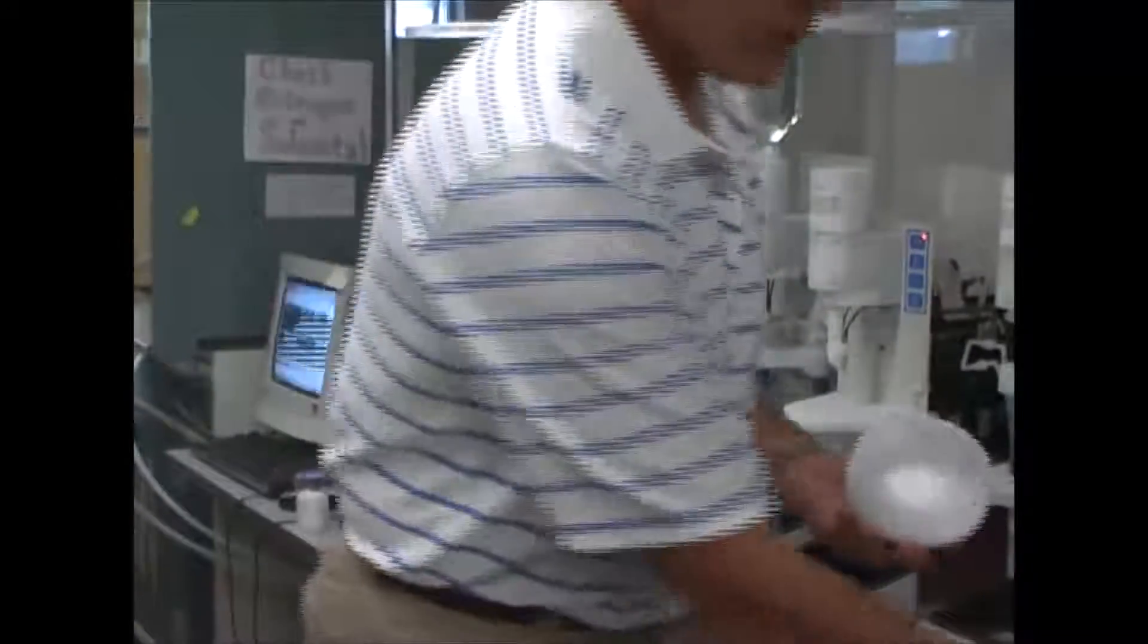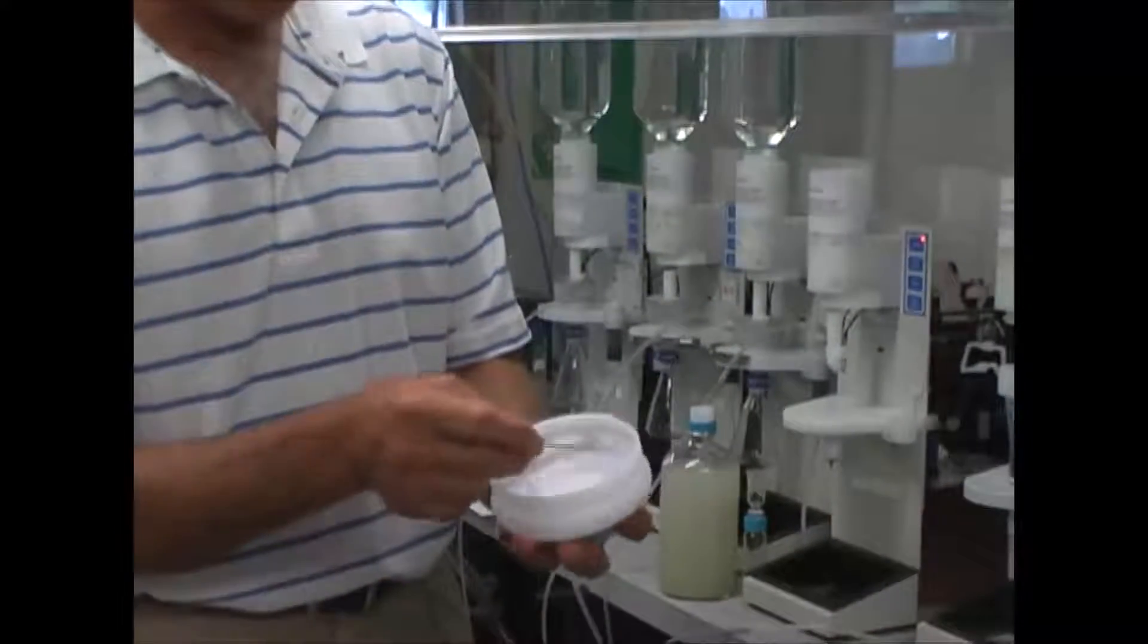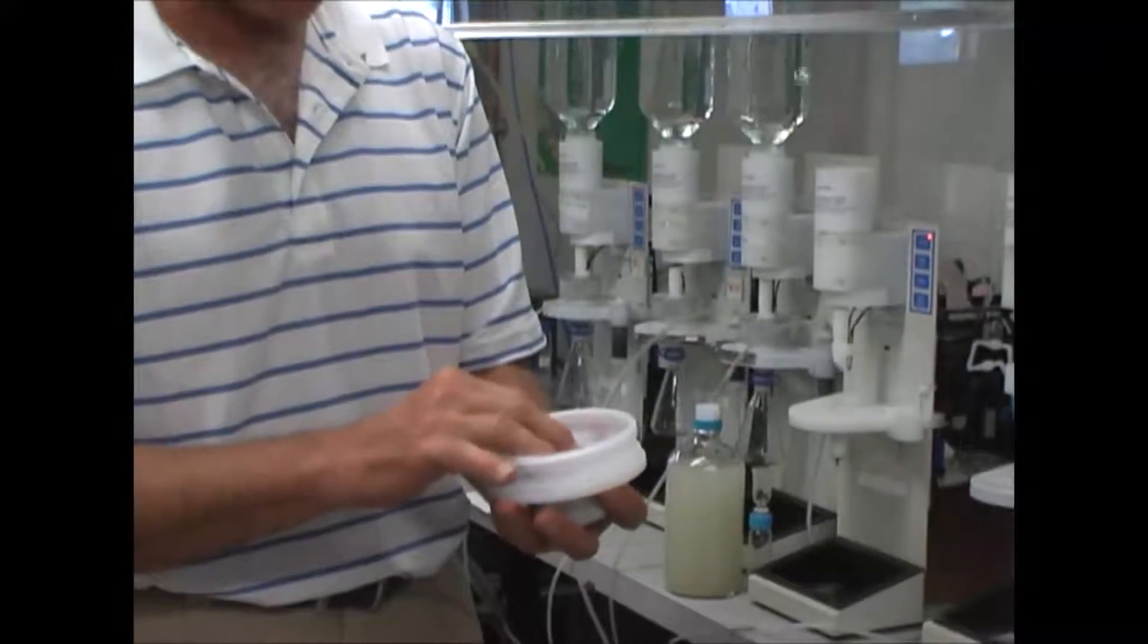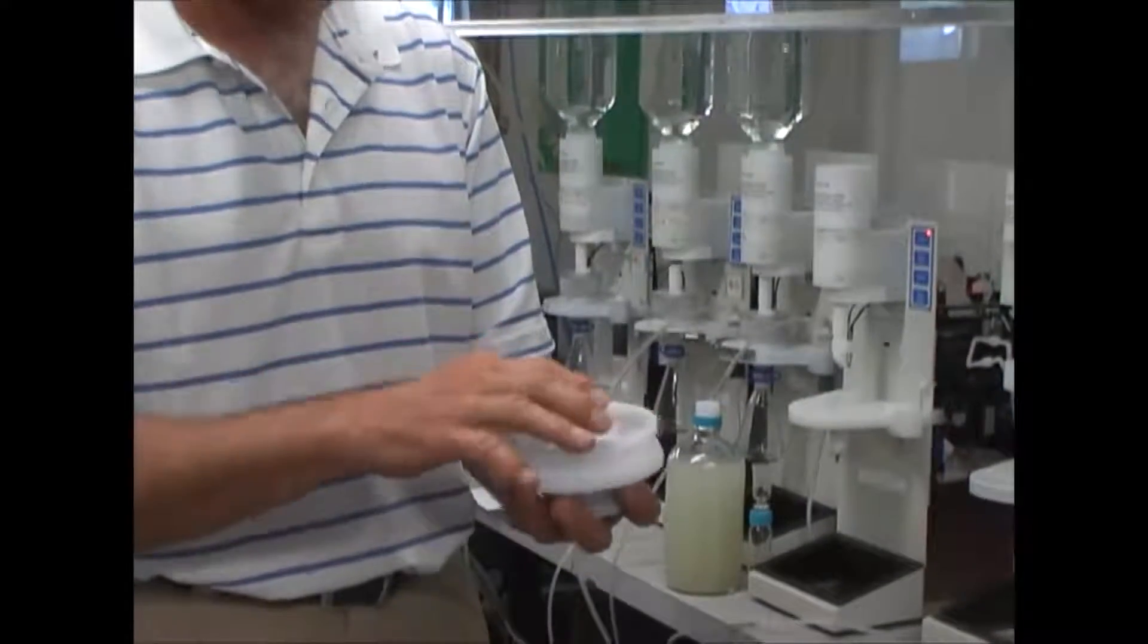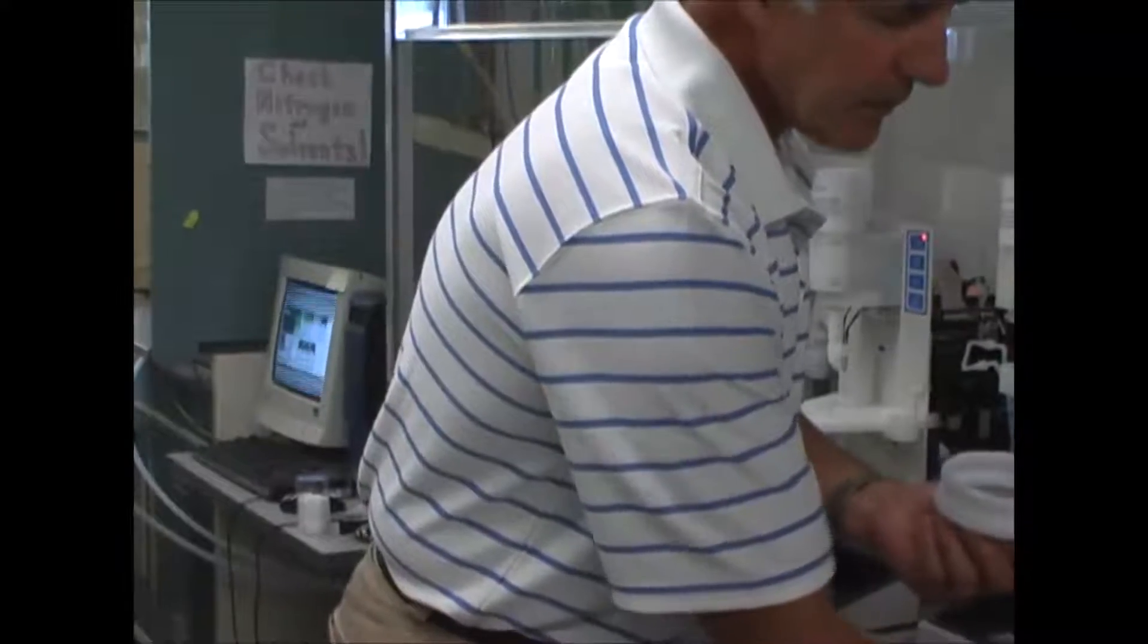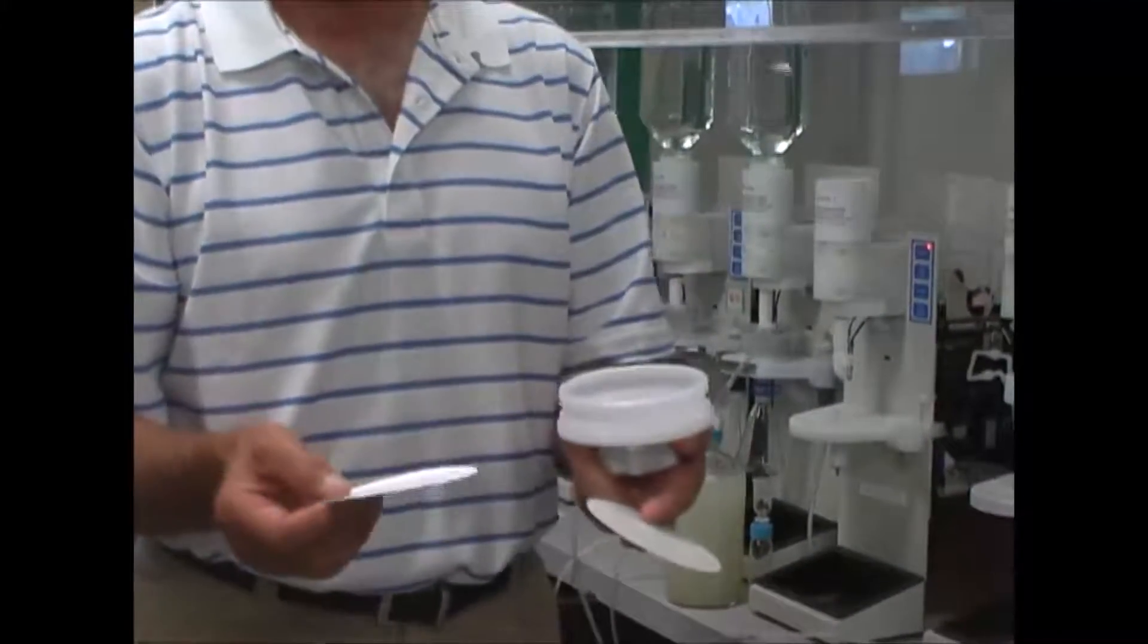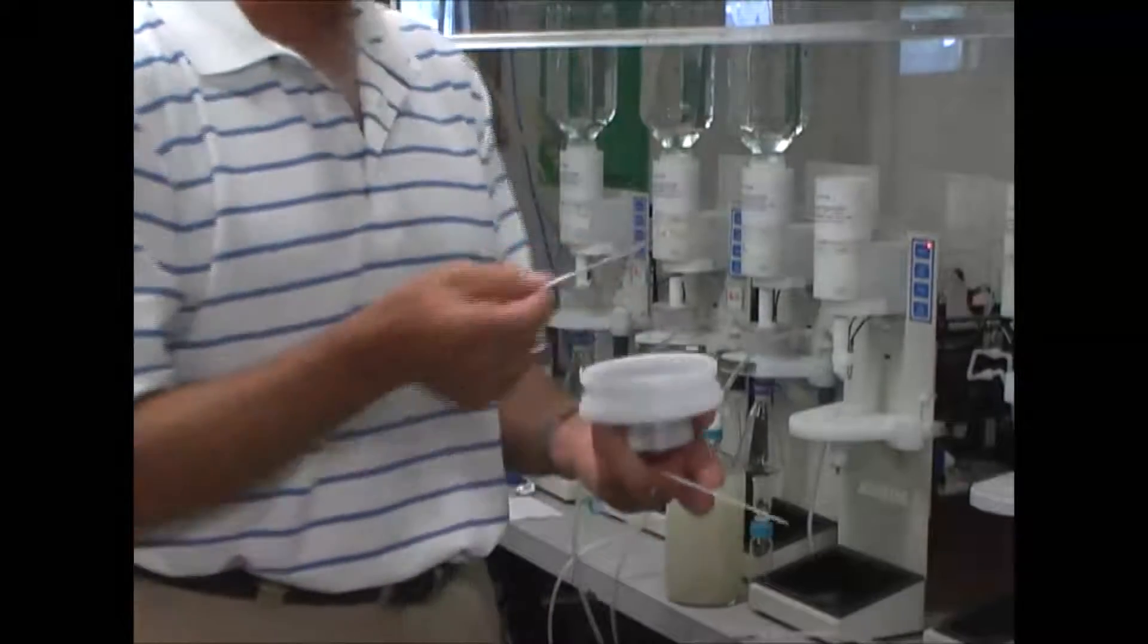On the top of this, I'm going to load a metal screen and the screen provides a pathway for the water sample to filter through.